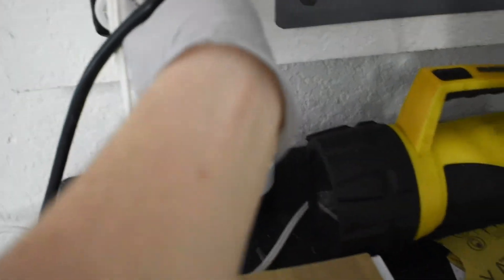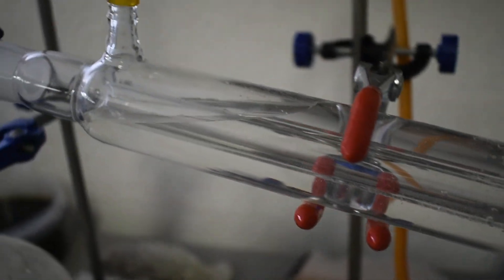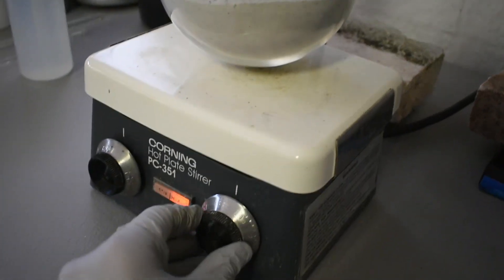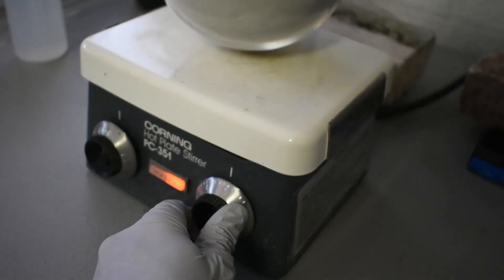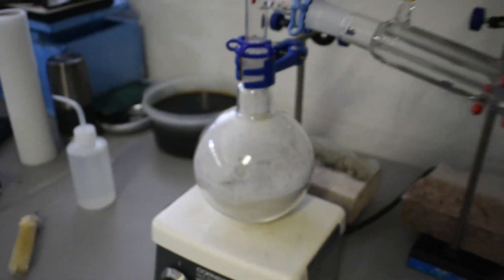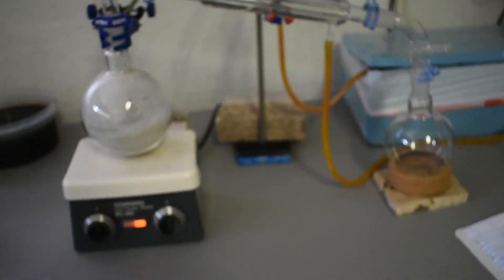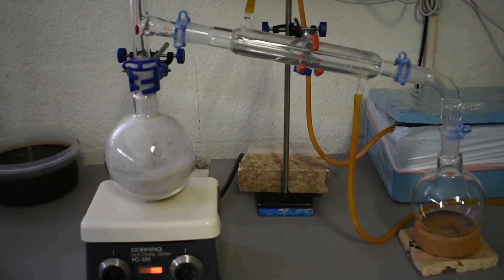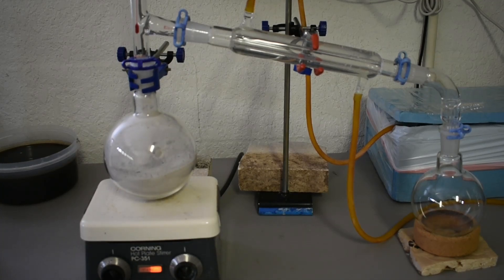Let me take off my protective thing. Plug it in. Here's our water coming up. And then we can start heating. I will come back when it's nice and warm.